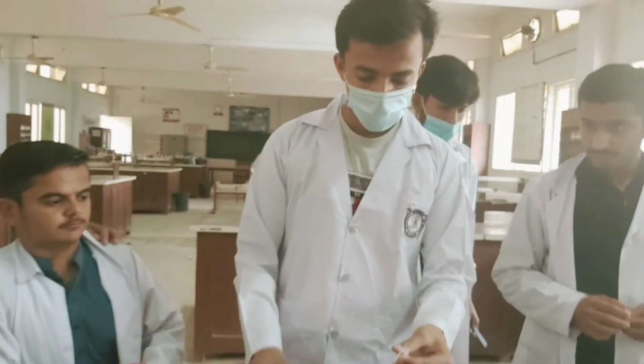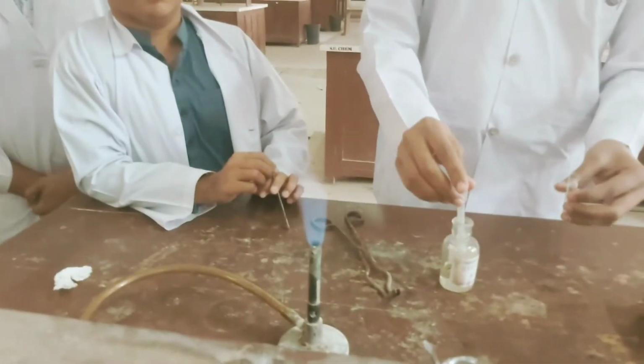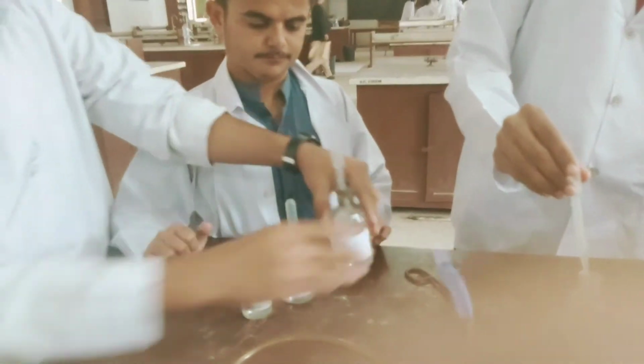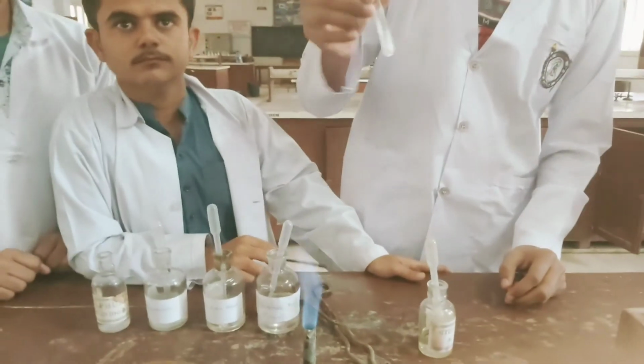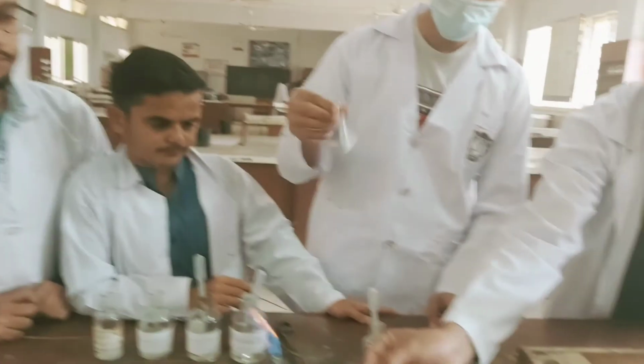How many solvents have you tried for your solubility test? We have tried almost 4 solvents and now it's the turn of the 5th solvent, dilute hydrochloric acid. Can you name the solvents you have tried up till now? Ma'am, first we tried chloroform, then carbon tetrachloride, then concentrated and dilute sulfuric acid, and now we are performing with dilute hydrochloric acid. I see. That's great. You have tried a number of solvents. And you are recording also the temperature ranges, whether at room temperature or on warming, on heating? Yes, ma'am. Okay, that's great.